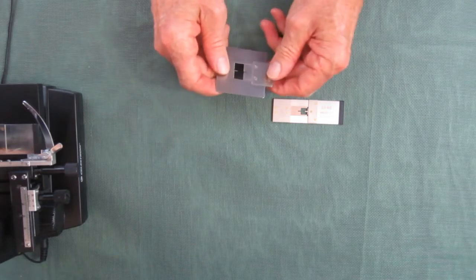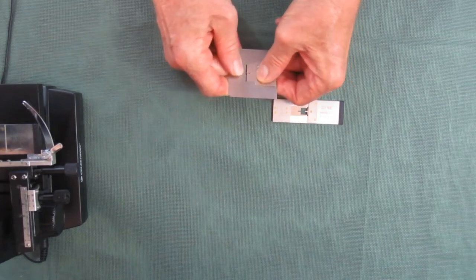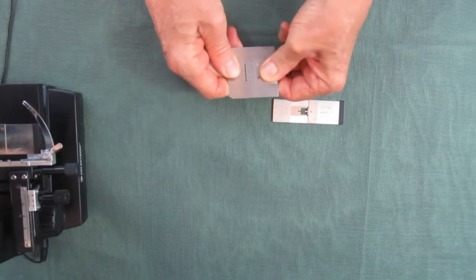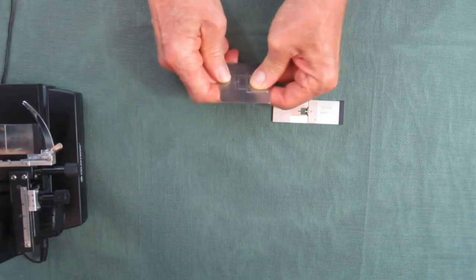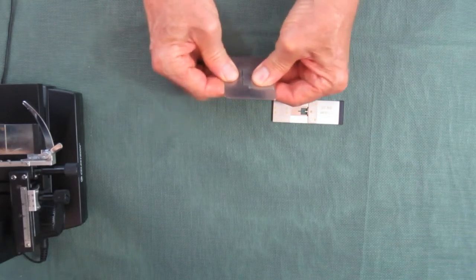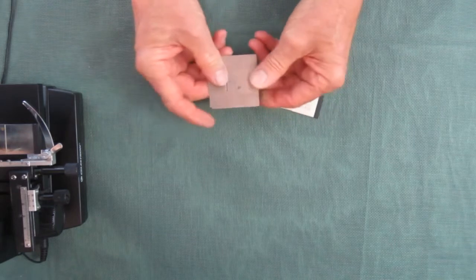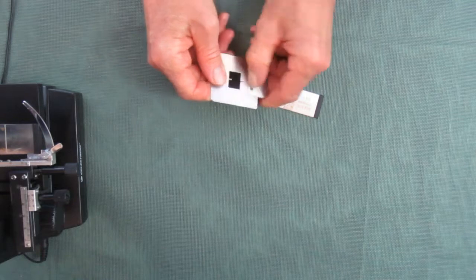And you can actually even flex them. You can see there's movement, you could feel a flex. I have to put pretty much pressure on it, but it is a fact that most of the time if you flipped it around, you'd get a better alignment one way than the other.